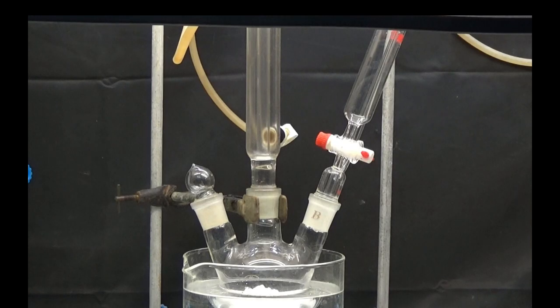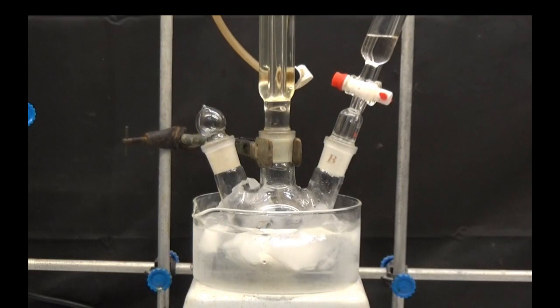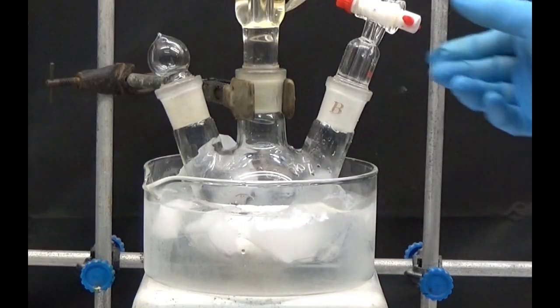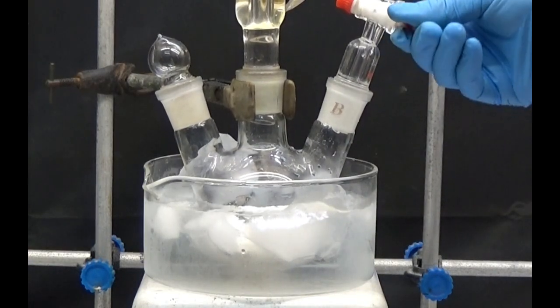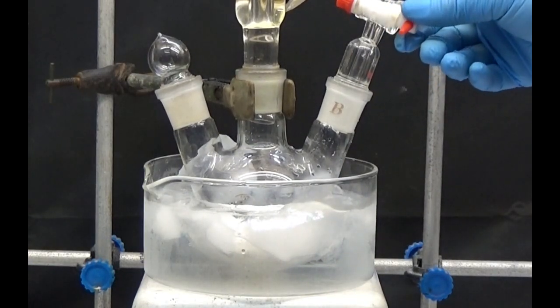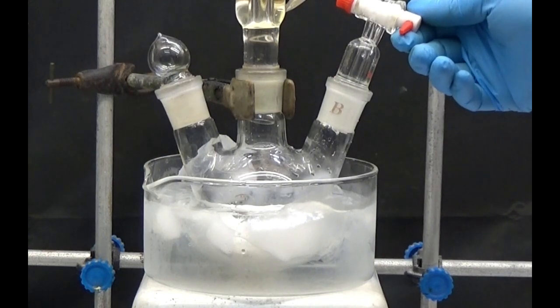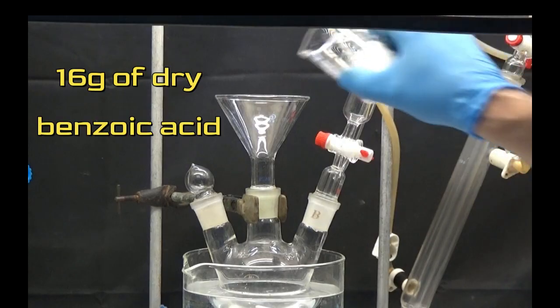Work in fume hood. To obtain the benzoyl chloride, we will assemble a reflux unit with a three-necked flask, 250 milliliters, a condenser and an equalized addition funnel. The flask is cooled using an ice bath and the condenser outlet is connected to the fume hood.